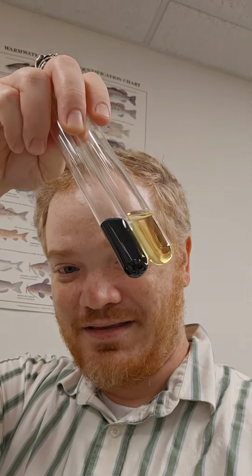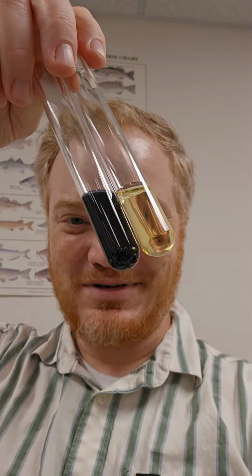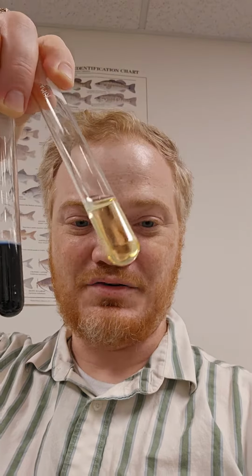Then we have these two. These are an iodine test looking for starch. When starch is present, iodine turns very dark. So the test tube on the right over here, I'm not sure how this is going to look from the imaging, but the one that is dark, that is positive for starch, and the one that just looks like iodine in water, that would be a negative for starch. Starch turns dark in the presence of iodine. A polysaccharide, as it were.